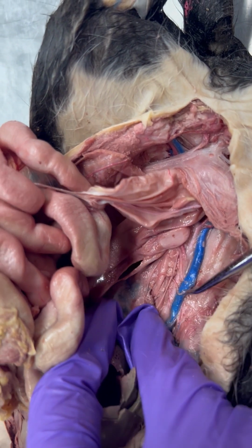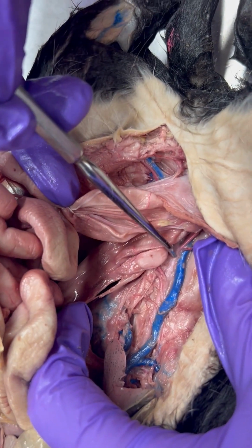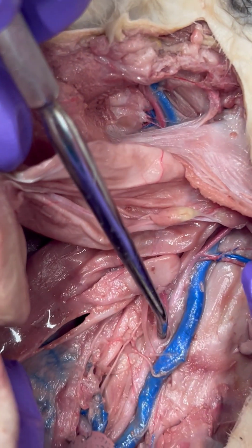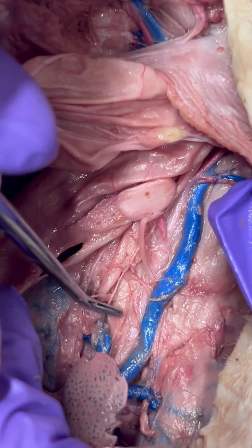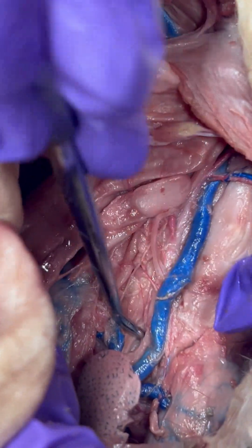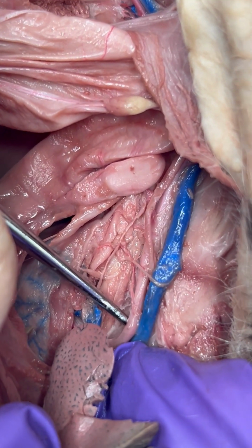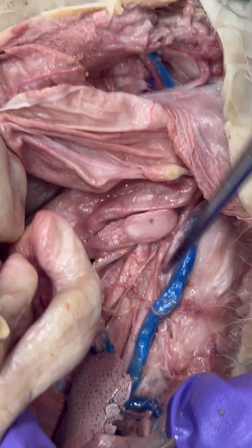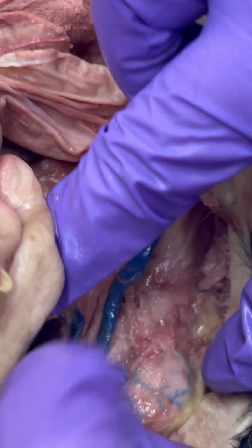Alongside that, we have the dorsal aorta, which lies against the body wall here. The red dye is not very obvious, but you should be able to see it, let me see if I can lift it a little with my probe here. We have the dorsal aorta. And then we have the renal artery and vein. Anything renal has to do with the kidney.